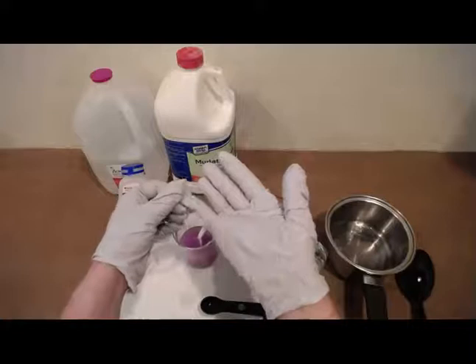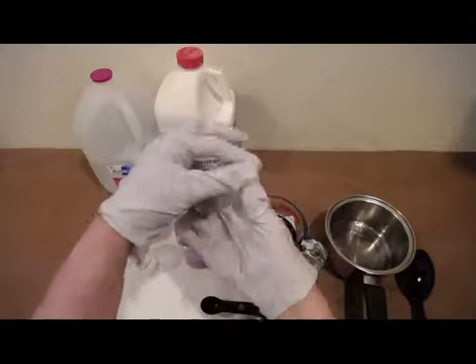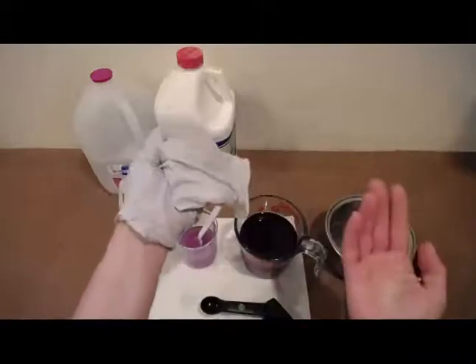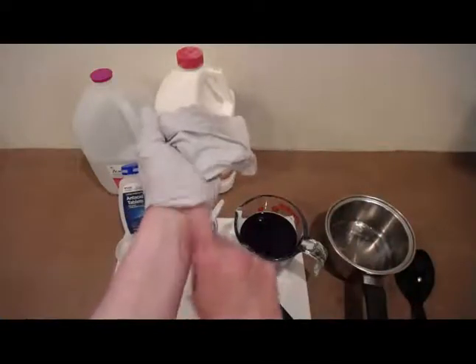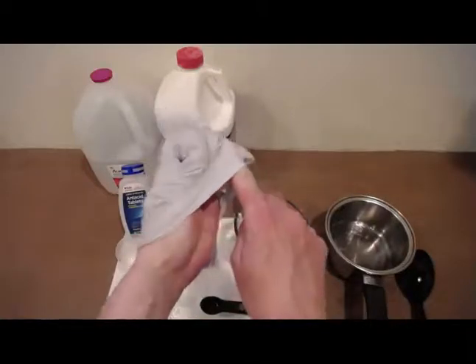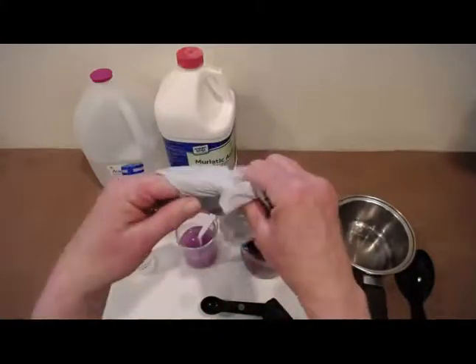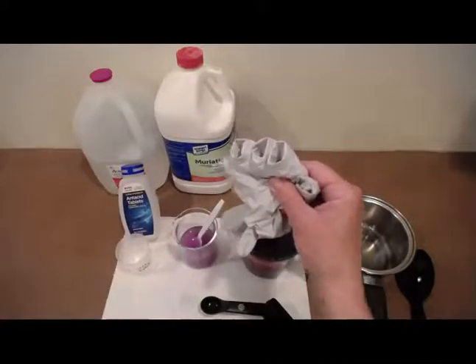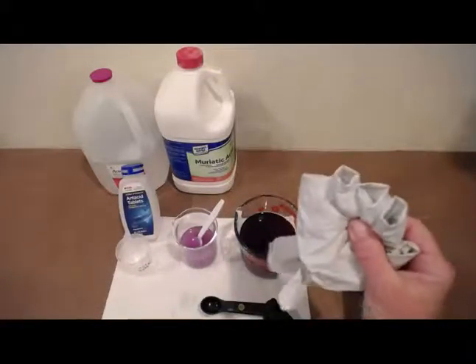A safe way to remove your gloves is take one gloved hand and you're going to remove the one glove. Okay, again, we're not touching anything that has been contaminated with acid. And then take this clean hand, tucking up underneath of your other glove, and then bringing it over the top, kind of turning it sort of inside out. And then we can safely dispose of the gloves in the trash can. But remember to clean up your glassware and your solutions before you do remove those gloves.